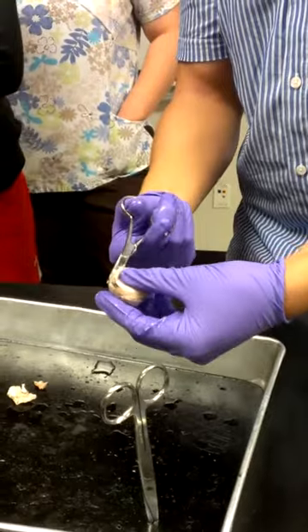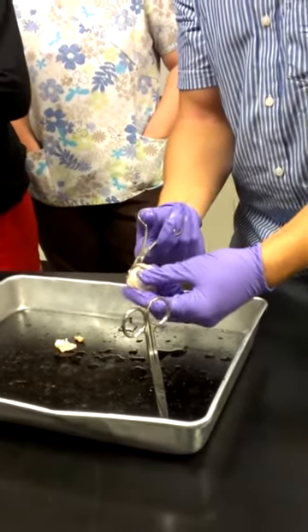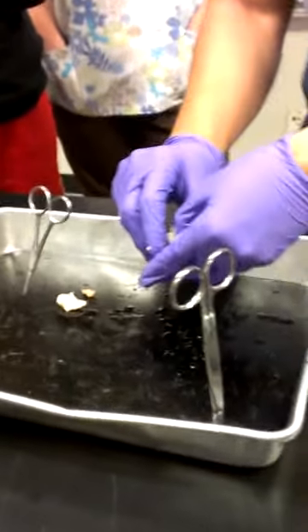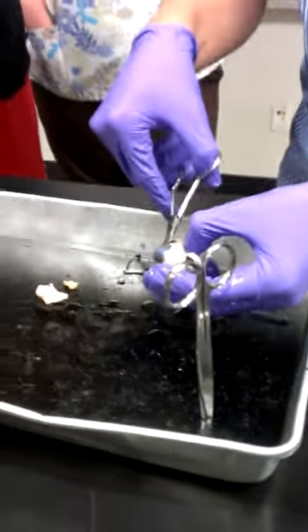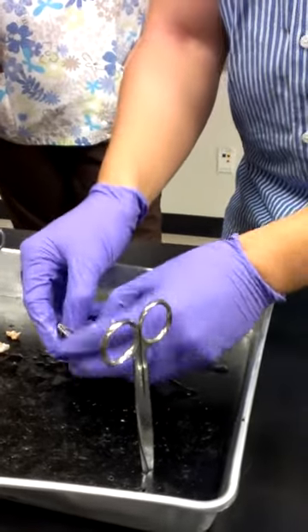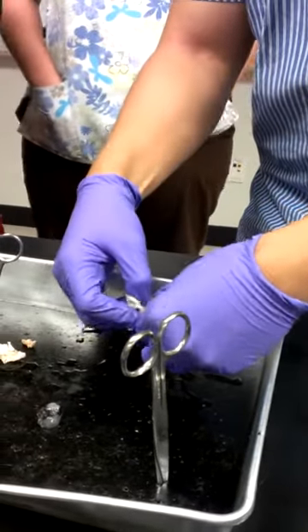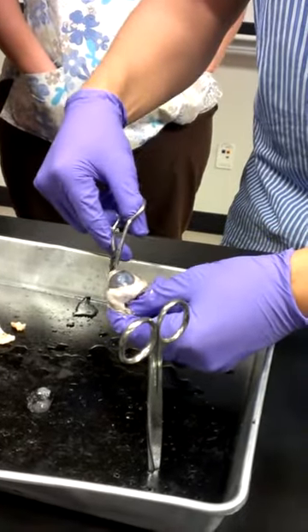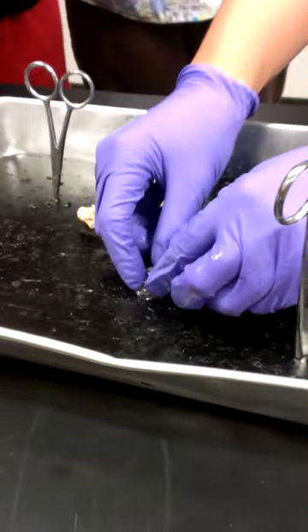You're going to just cut around the eyeball. When you guys open it up, you're going to see basically two things that come out. One of them is this little hard knob, little ball-like structure — this is the lens.